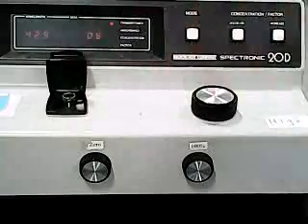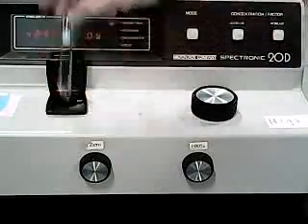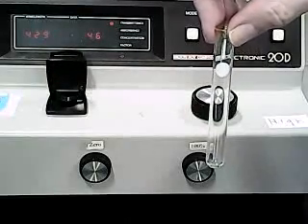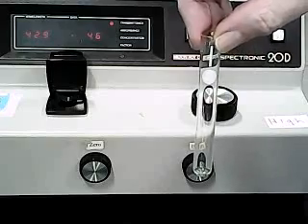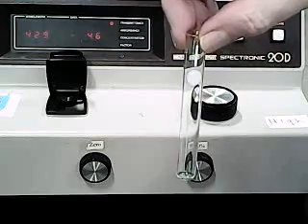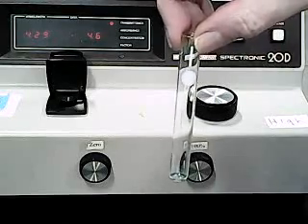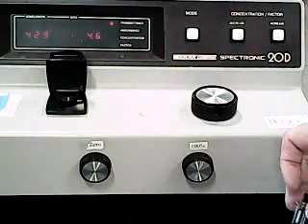In the left top of the deck, we have the sample chamber. And what we use in the sample chamber is one of these. This is known as a cuvette. It looks like a test tube, but in actuality it's very specially designed and constructed to be optically clear. That is, there isn't any distortions in it that will affect the amount of light passing through. And that's the equipment we're going to be using today.